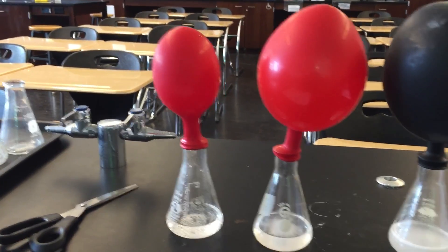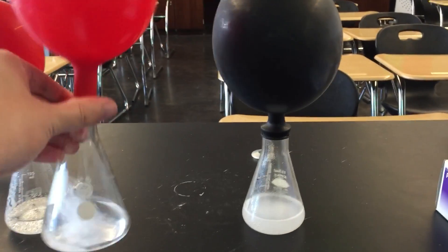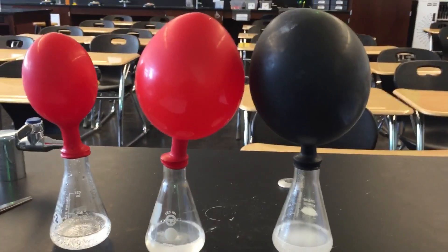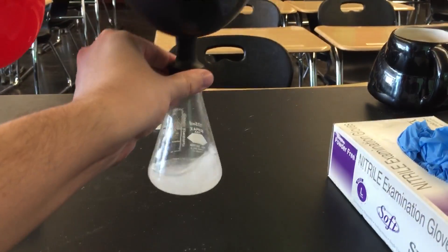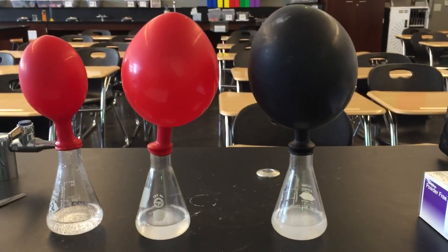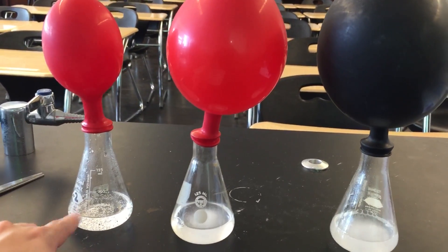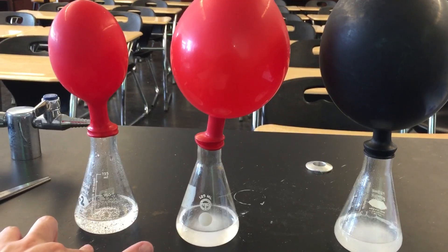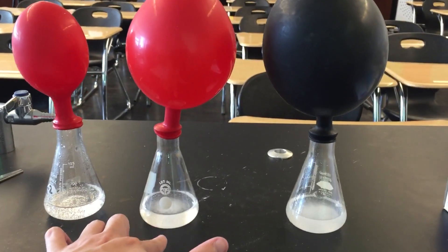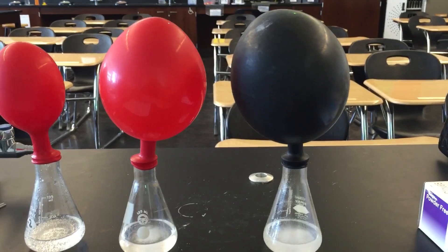So we have balloon number one, balloon number two, and balloon number three. And that's still going on. And so what did you notice? So you should notice that this one has the least amount of CO2 gas made. This one has a reasonable amount of gas, and so does this one.